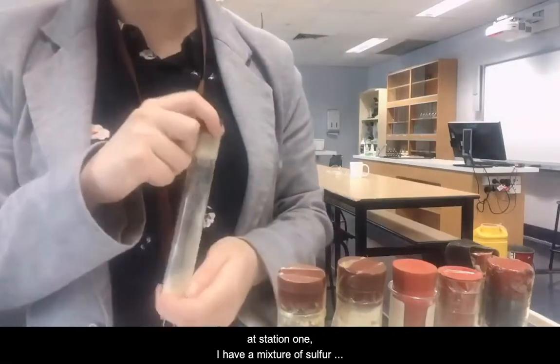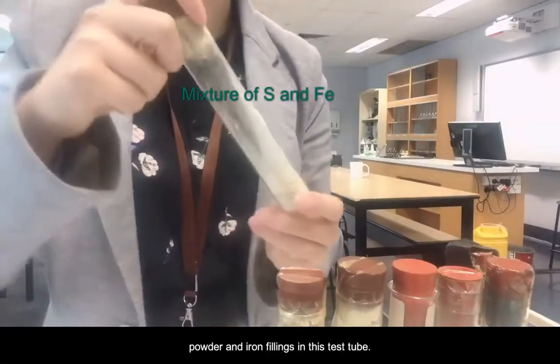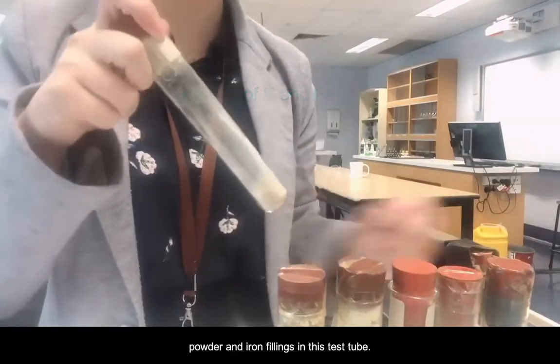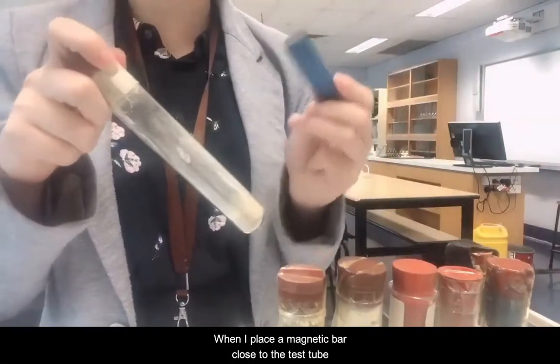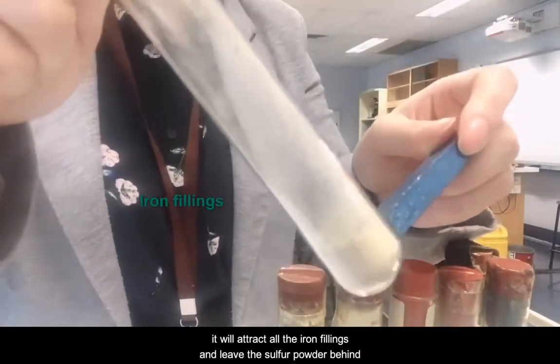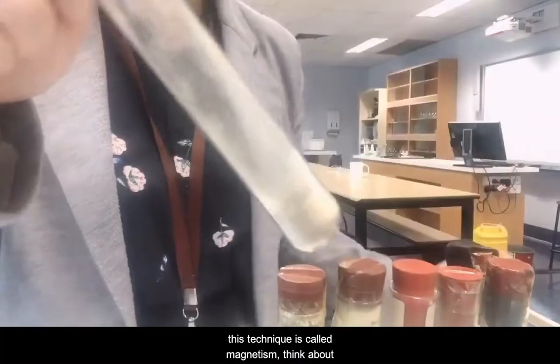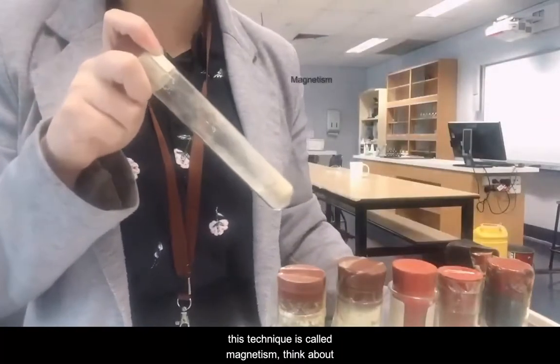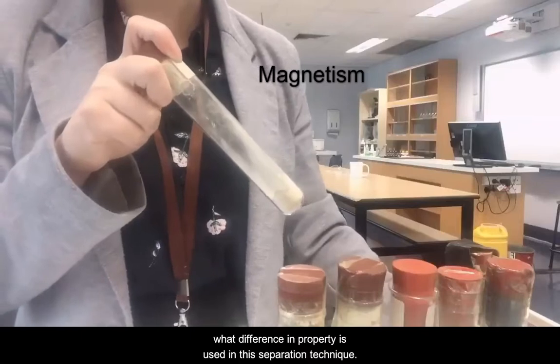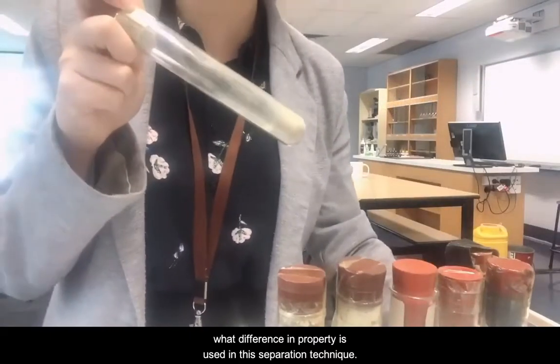At station 1, I have a mixture of sulfur powder and iron filings in this test tube. When I place a magnetic bar close to the test tube, it will attract all the iron filings and leave the sulfur powder behind. This technique is called magnetism. Think about what difference in property is used in this separation technique.